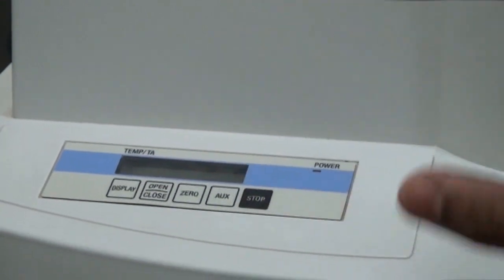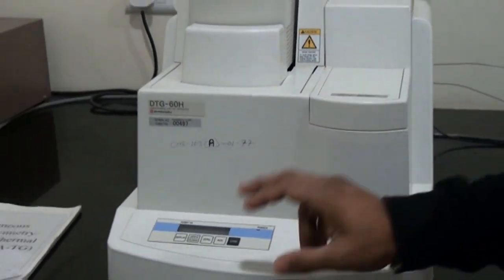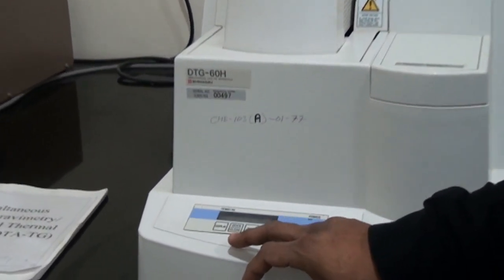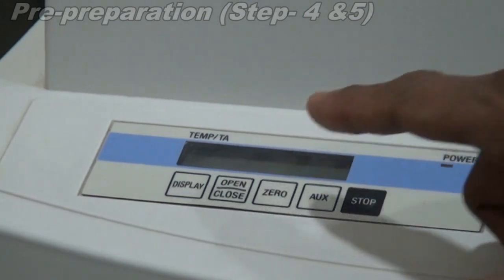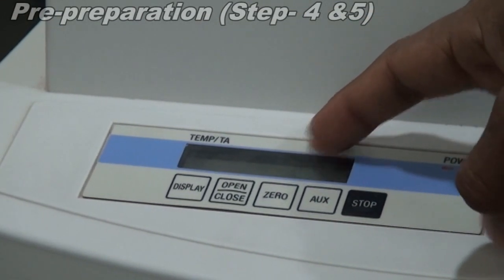As soon as you switch on the DTG60H, you will see initial, and after that it will start displaying the temperature, which is the TG signal. If you want to go to the DTA signal, you just have to press it here once, and it will show the DTA signal.